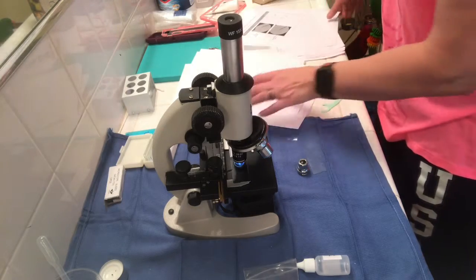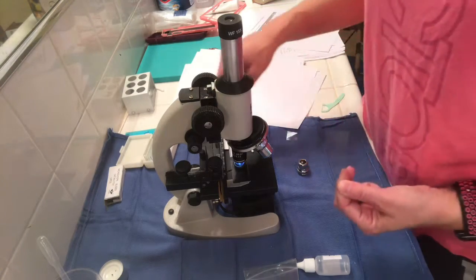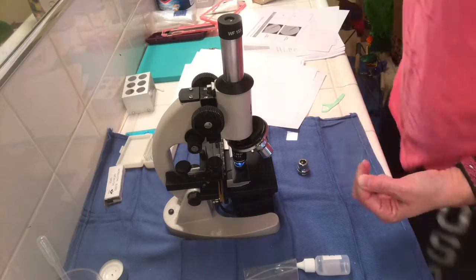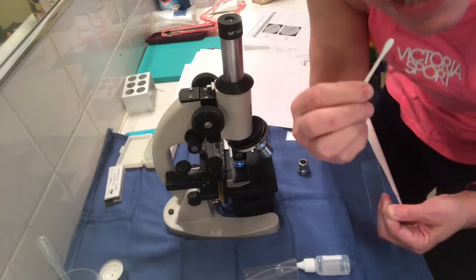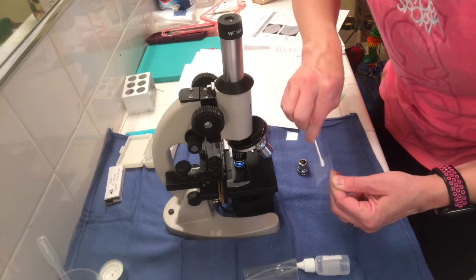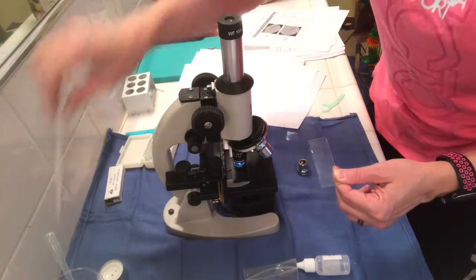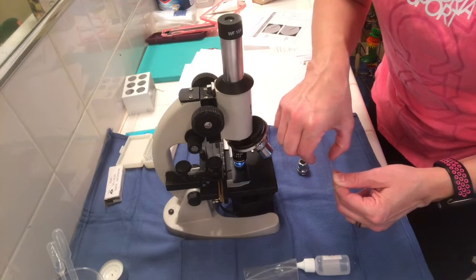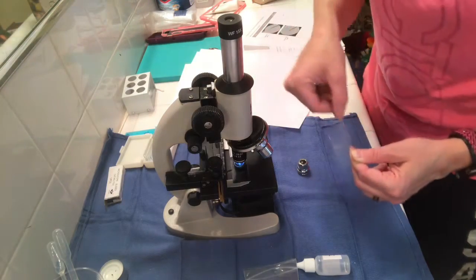The other thing I found was when we did our preparing the wet mount slide, which what we did was we took a slide, we took a sterile Q-tip, wiped the cheek, and then I dotted it on here. Then I took a drop, but I needed to make sure that I used a very small drop. And then a cover slip, and when I put the cover slip on, I just let it go, and then I used a paper towel to dry the edges.